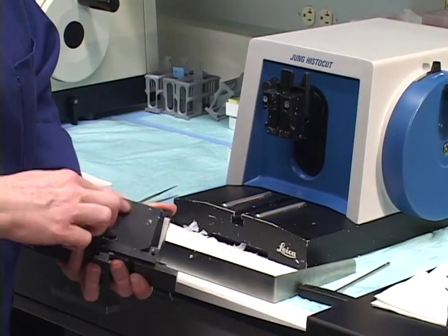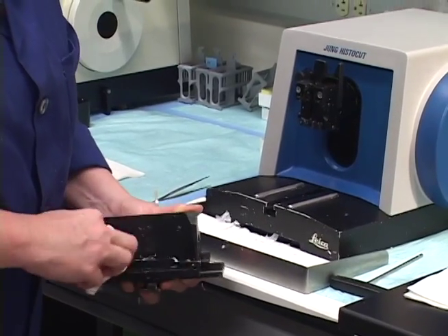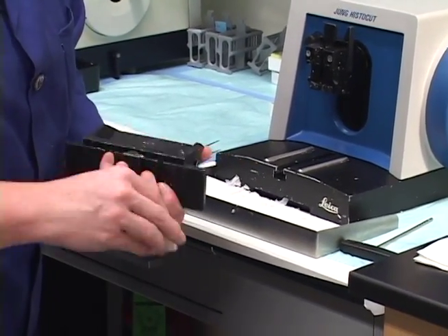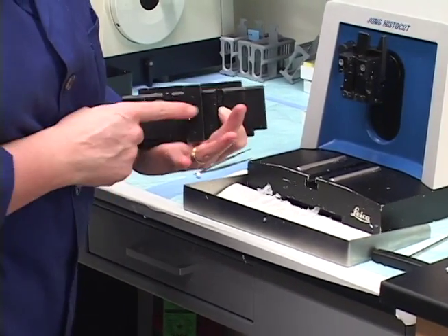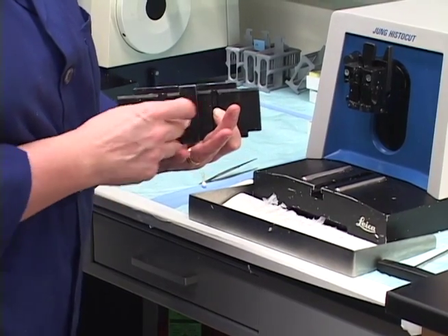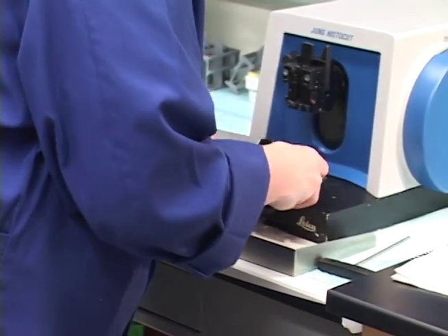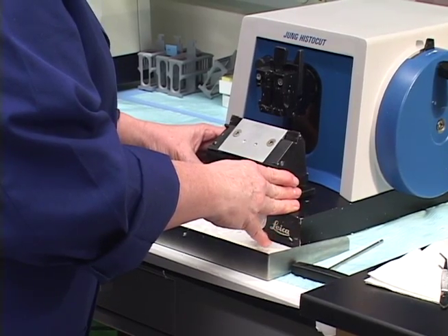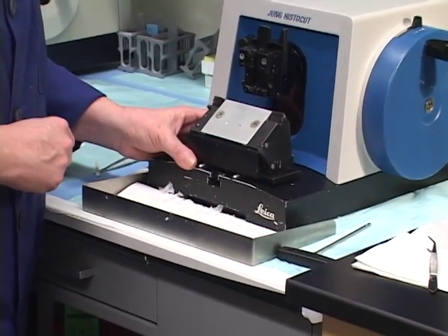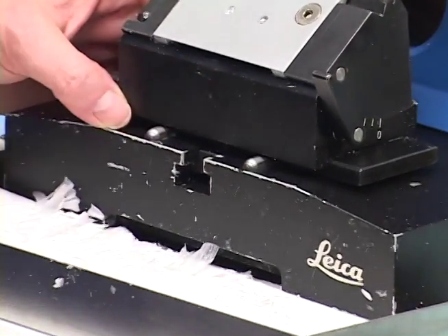Paraffin buildup on the back of this will make it so you don't get a ribbon. Once in a great while, this will start to loosen just a little bit. So if that happens, you'll feel it because when you put this back in, you just slide it back in. I leave about a little over a quarter of an inch sticking out of this slide here.